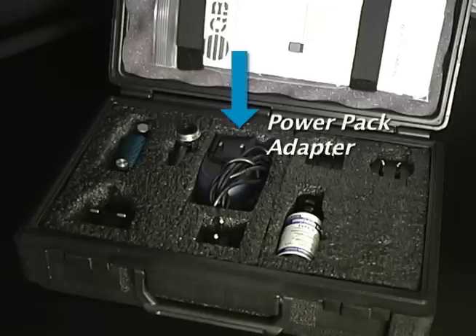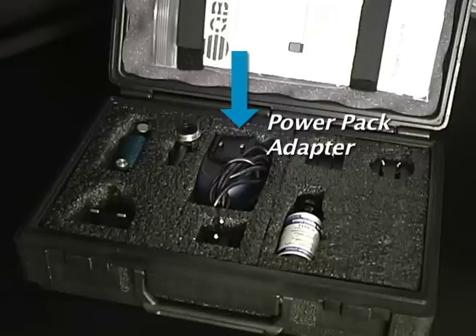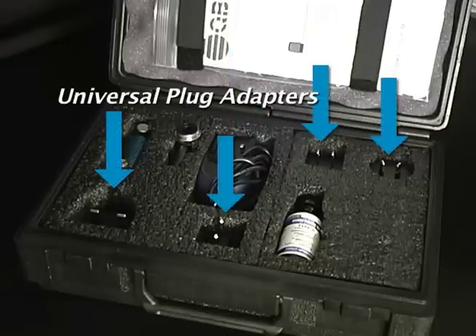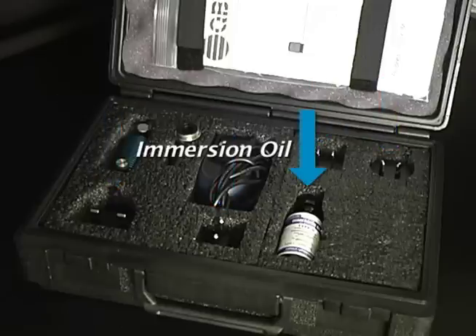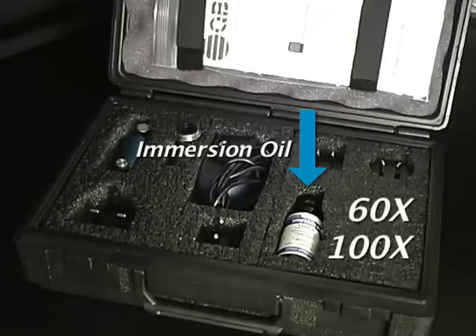The power pack adapter is inserted directly into the LED light source and then plugged into any approved electrical outlet. Universal plug adapters, which are provided, allow the Paralens to fit into the various outlet configurations around the world. Immersion oil is also provided and used when viewing slides with 60 and 100 times magnification.